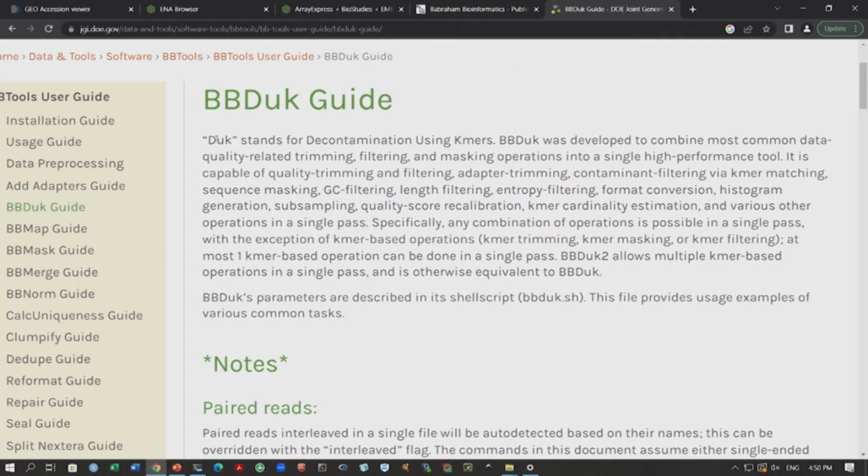Okay. So, you have DUK, which means Decontamination Using K-mers, right. So, if you have adapter contamination, you want to do trimming, you can use this tool. Okay. You can also do quality trimming or filtering, and you can do adapter trimming. You have all these options here. You can see this adapter trimming or contaminant filtering, right. So, we will do this adapter trimming using this tool. Now, what is the algorithm? How does it do this?